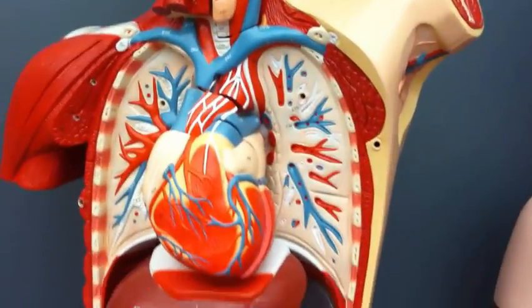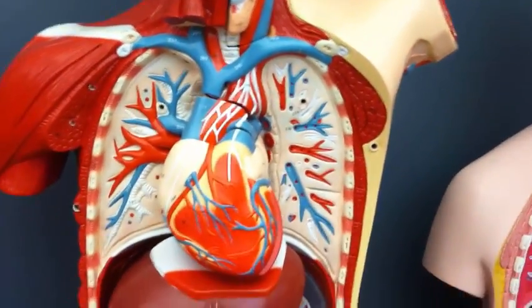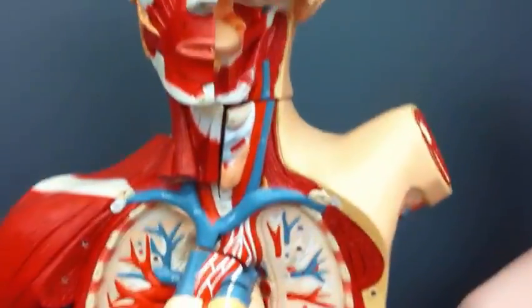Hi, this is Dr. Ren Hartung at Glen Oaks Community College, and for this video I'm going to go freehand with my camera and show you the blood vessels that we have on our anatomical models and on some dissections. I'll look at this model first because I've got two of these in the lab. We'll start from up top.